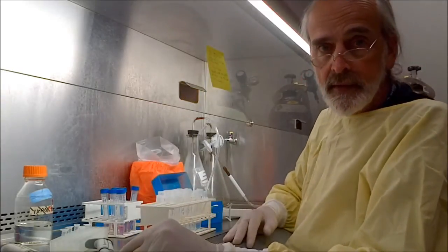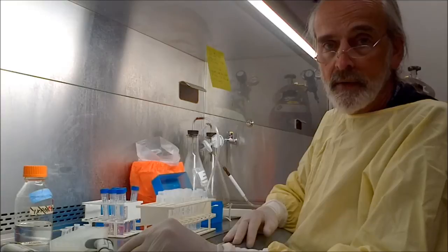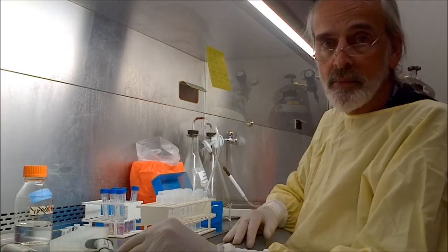So basically that's it. I'll come back later and I will infect the cells and do a reading later to see how some of the plates have done.